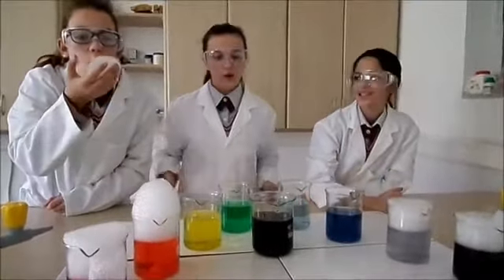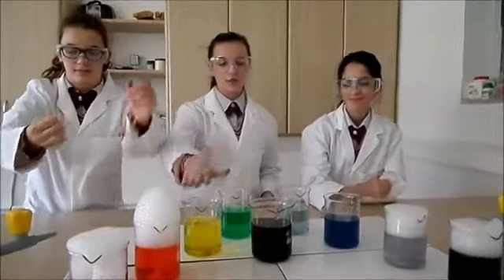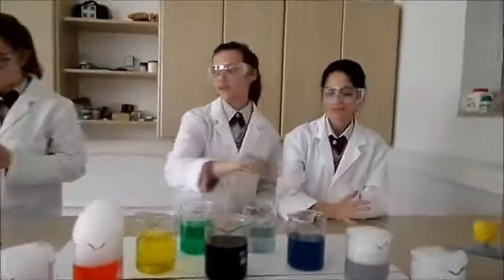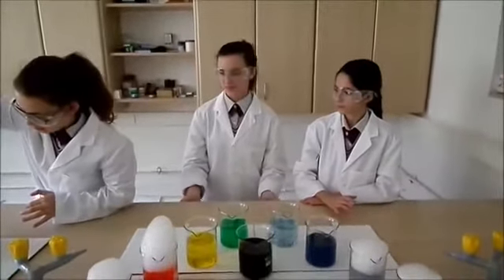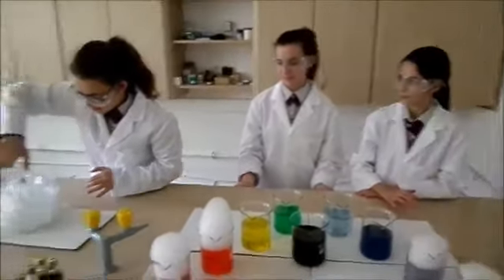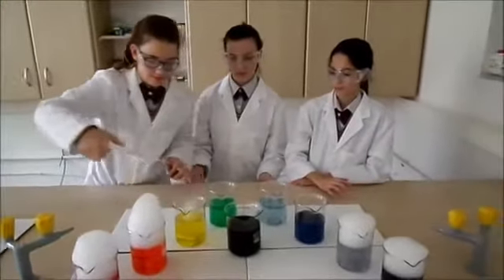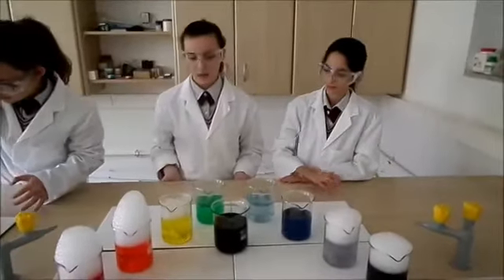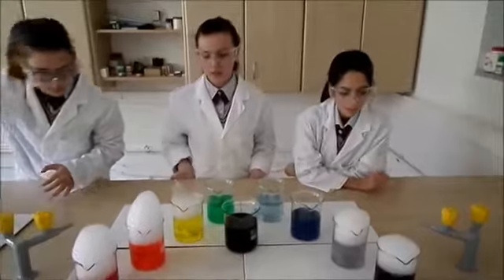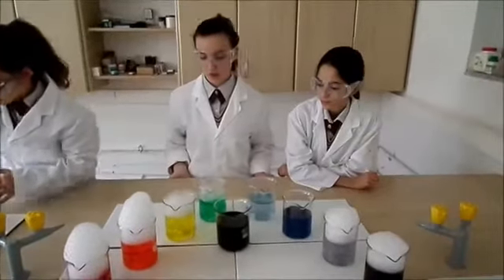We are now going to add dry ice to these four beakers. These four beakers do not contain soap, like the other ones. As you can see, they do not have any soap in them, so bubbles are not formed.